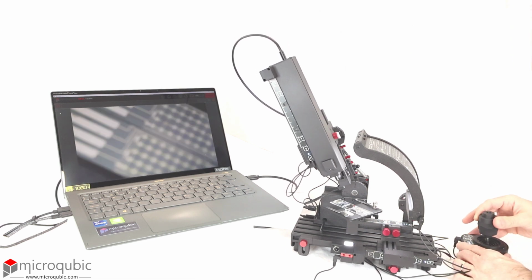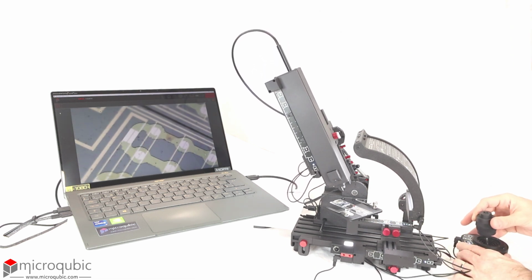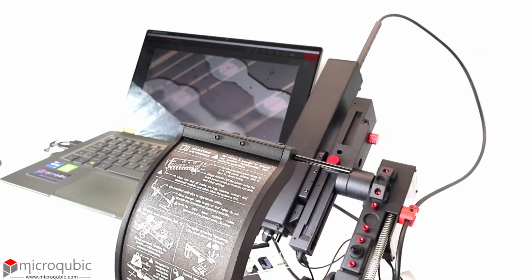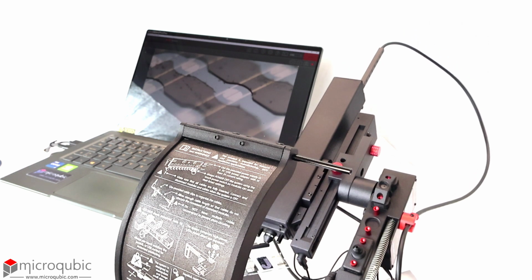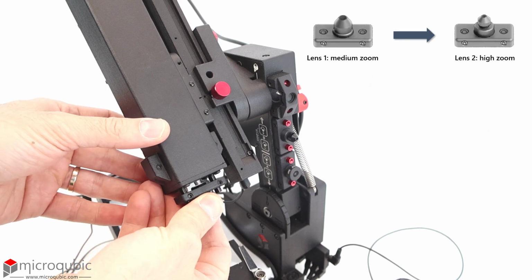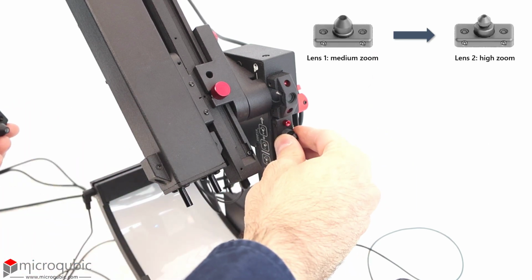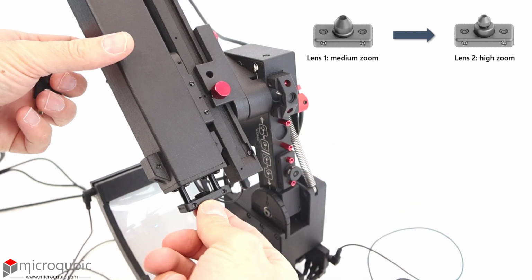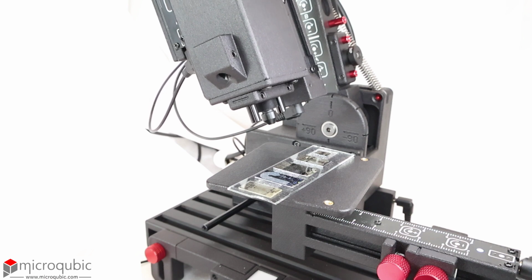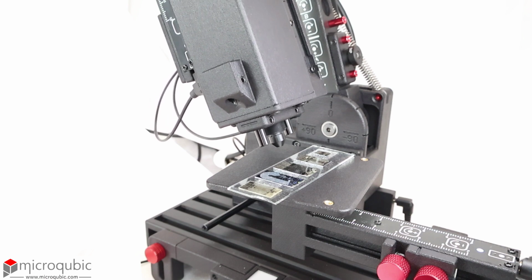When properly positioned, this light source can always illuminate the sample for almost every imaging angle thanks to its curved profile, so you don't need to adjust its position continuously. You can switch to the high zoom lens for applications requiring a higher magnification level. Note that this lens has a much lower working distance and dynamic range than the other lens, so it must be closer to the sample.